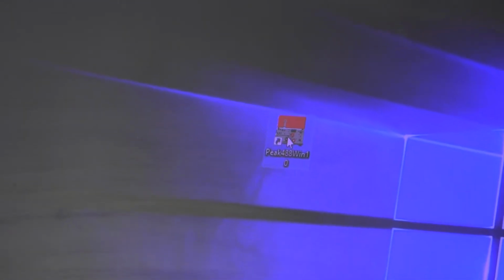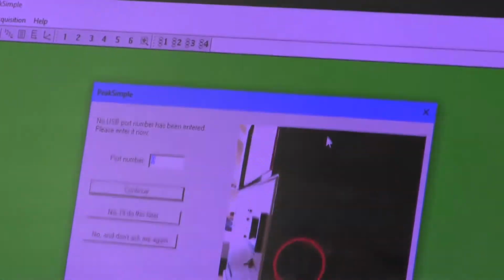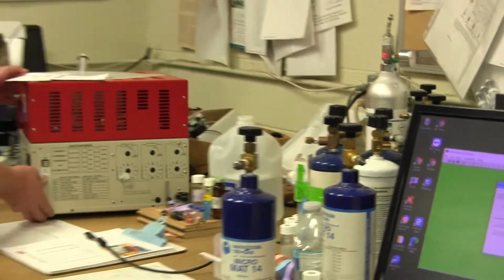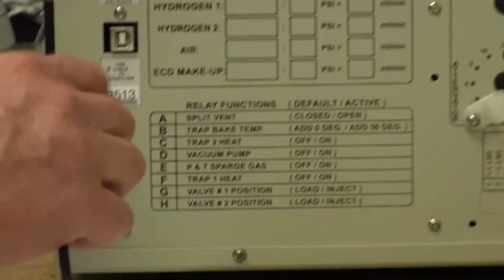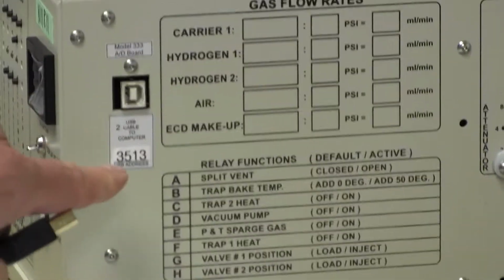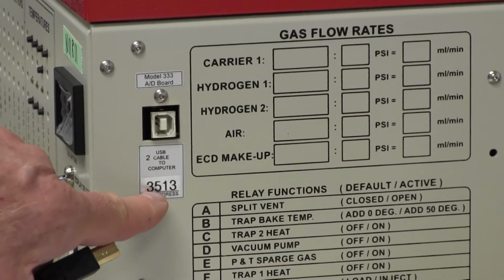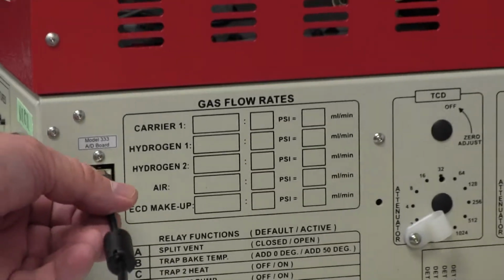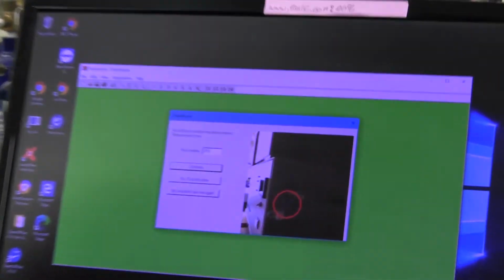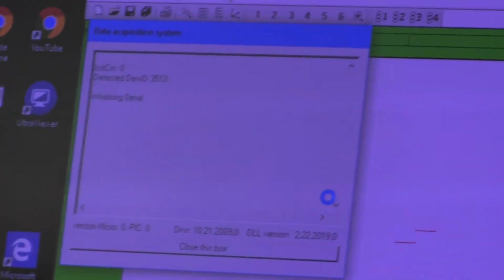So I'm going to launch Peak Simple by double clicking on the icon, and the first thing Peak Simple wants to know is the port number. So every GC has a port number. It's located immediately below where you plug the USB cable in. So this particular GC number is 3513. So that's the number that it's asking for here, 3513. So when I click continue, it tries to connect to the GC.